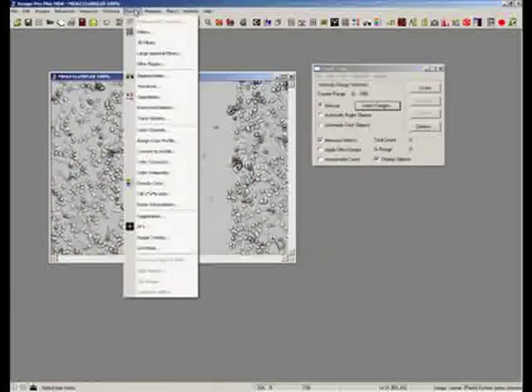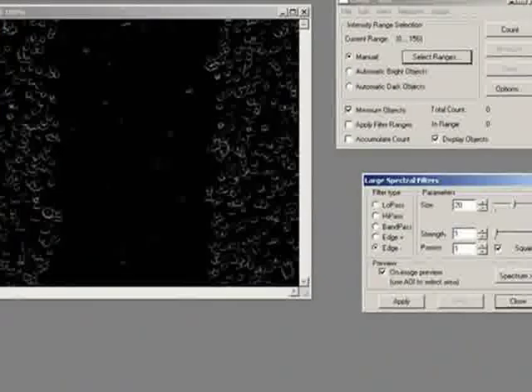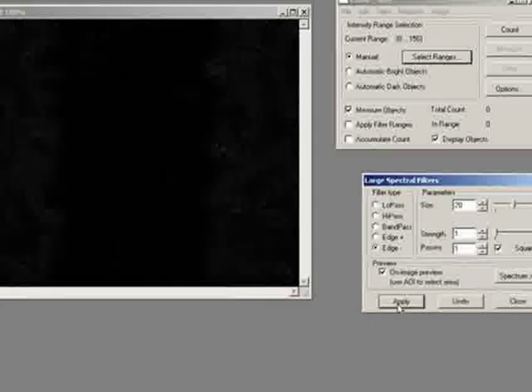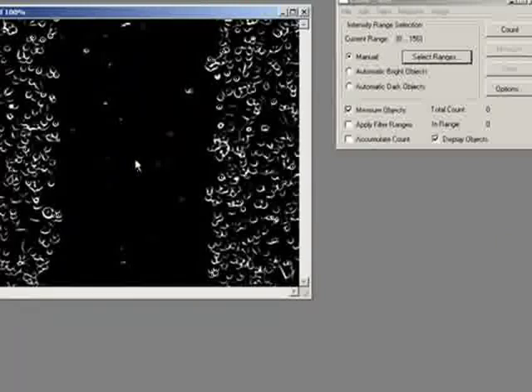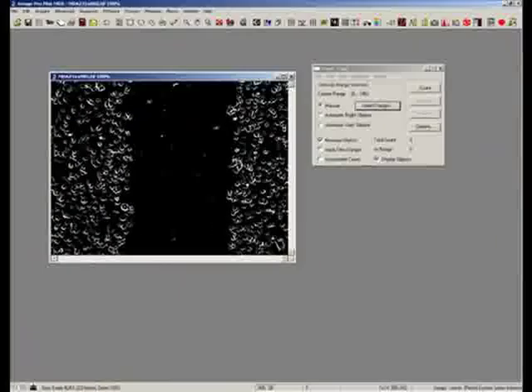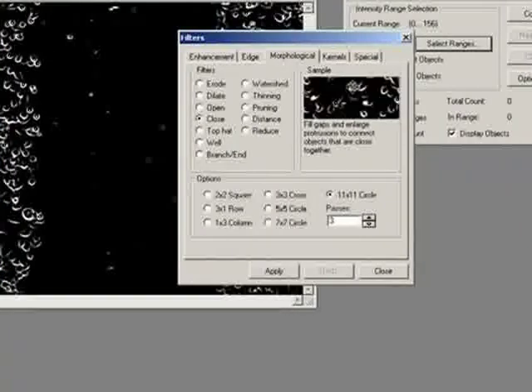So what we're going to do here is something called a large spectral filter, and that's going to effectively put an edge on to everything that we're looking at, and that can be a positive or a negative edge. So just press apply. Okay, and now if I just brighten up my image, you can see what we've got here. And next I'm going to try and connect all of these objects up together by using a close filter.